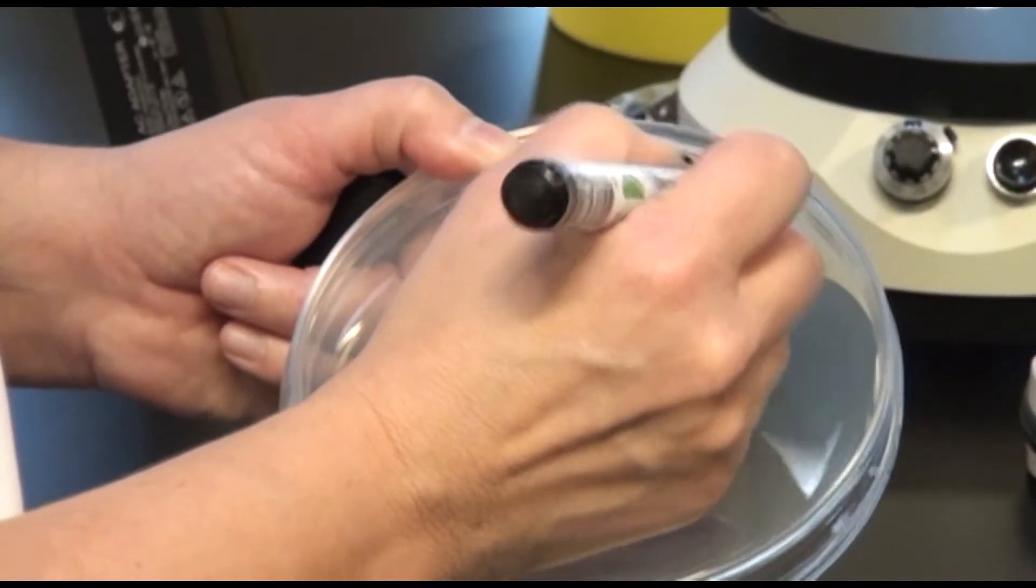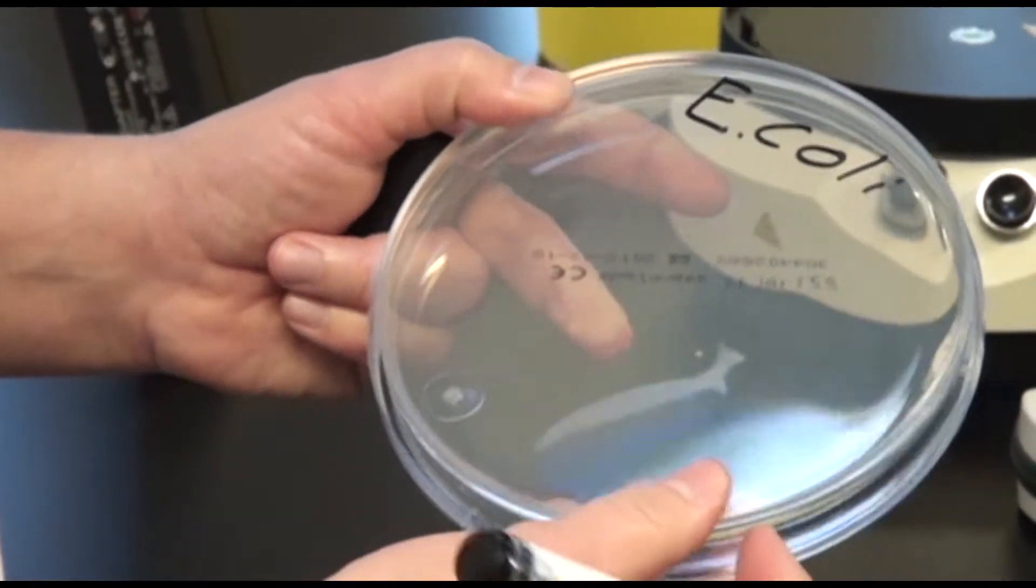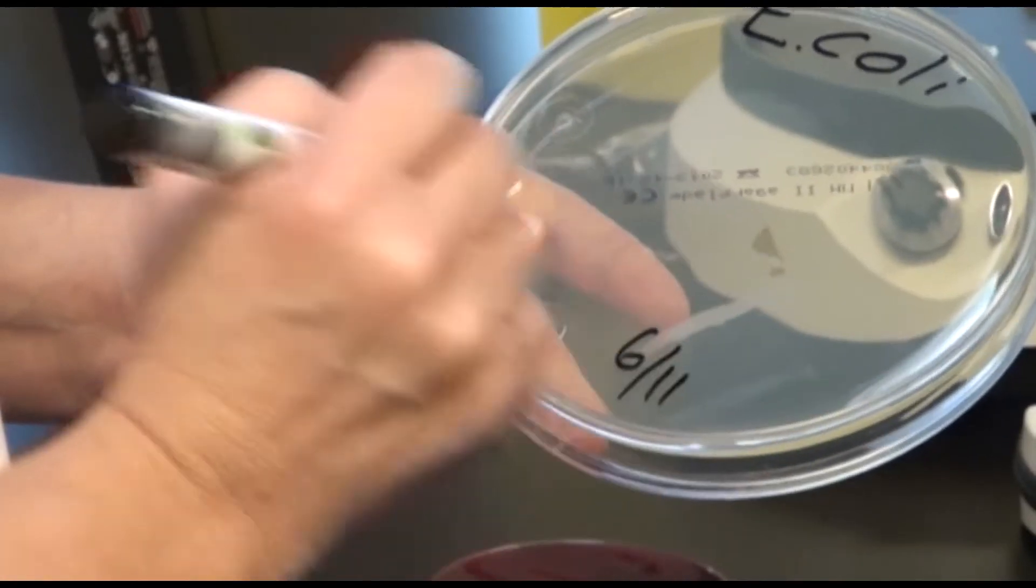I start by writing name and date on the resistance plate so it is identified for the next day.